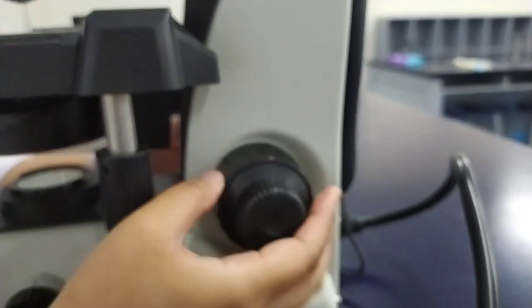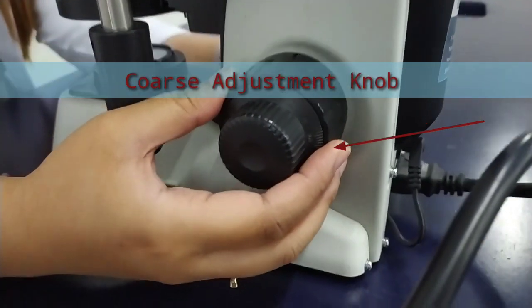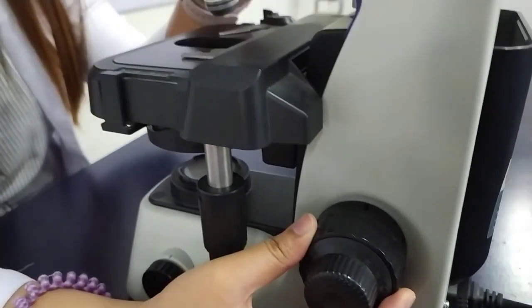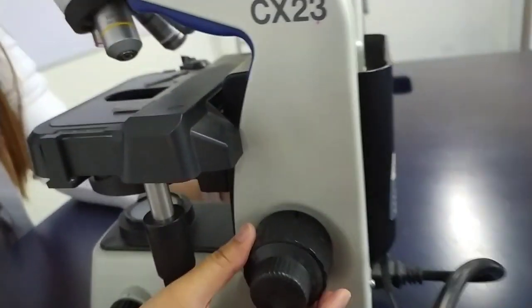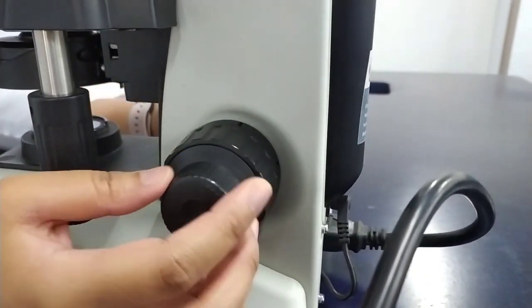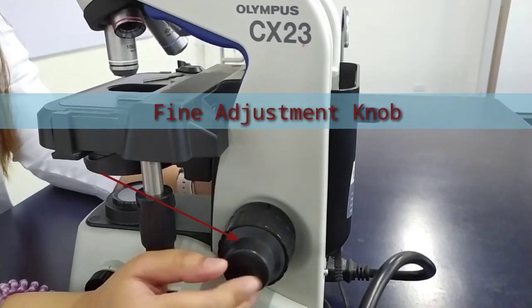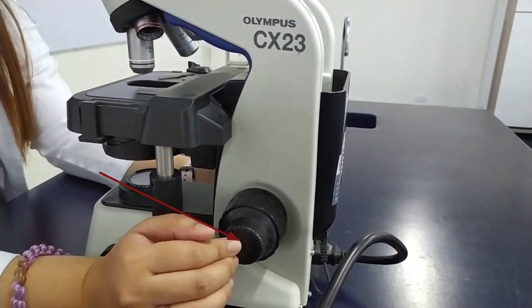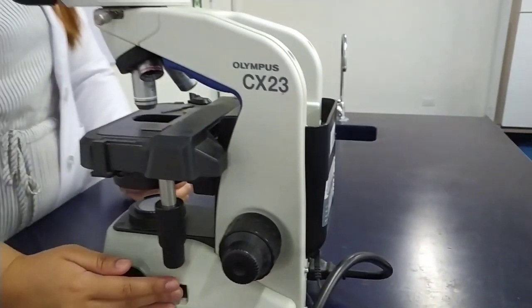Coarse adjustment knob, used for focus on scanning. Usually, the low-power lens is used enabling the movement of the tube. Fine adjustment knob, used for focus on oil. Moves the body tube for focusing the high-power lens.